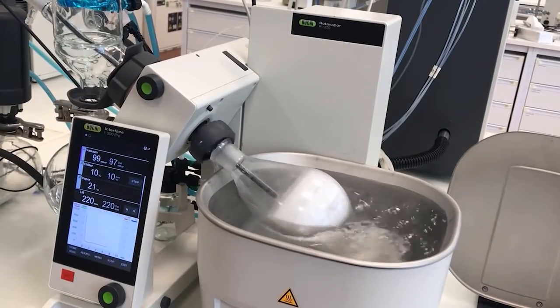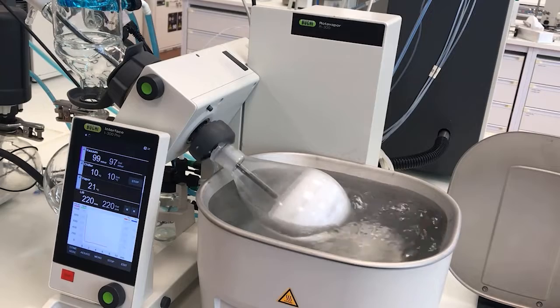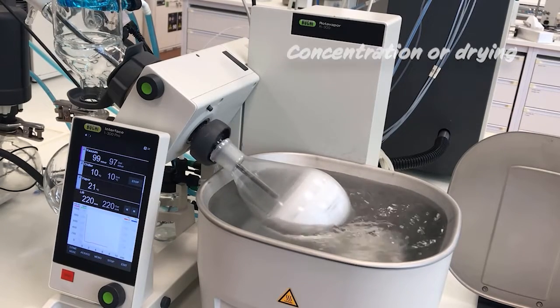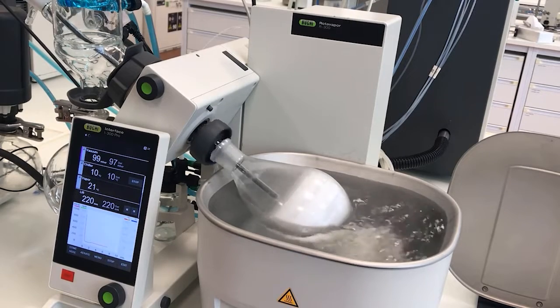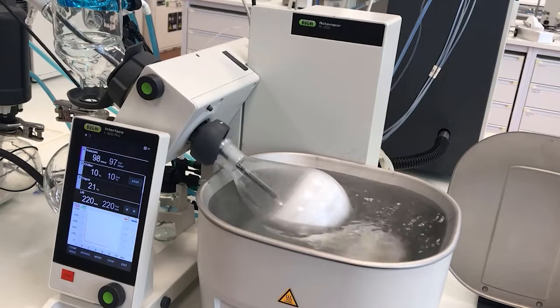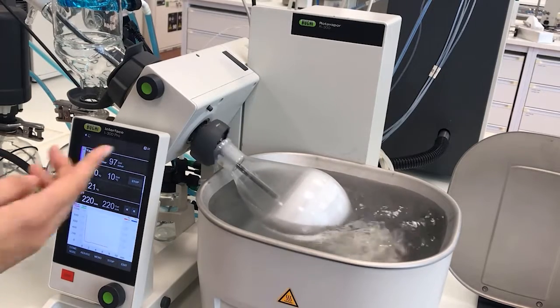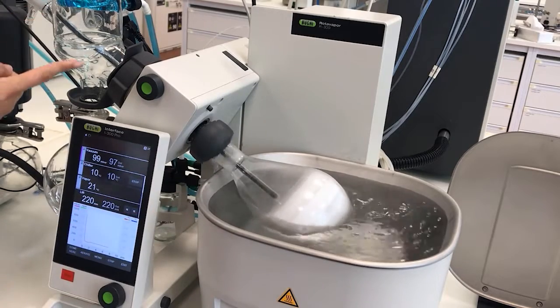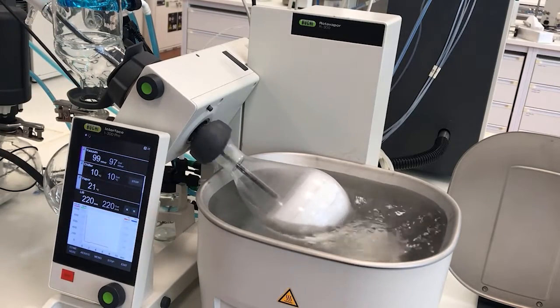Now comes the end of the distillation. We need to choose between concentration or drying. In our case, we needed to dry our sample, and as you can see, the sample is now completely dried and is a white powder. We know that the evaporation is finished because there are no condensation droplets falling from the condenser coils, or we can also see it from a sudden decrease in vapor temperature.